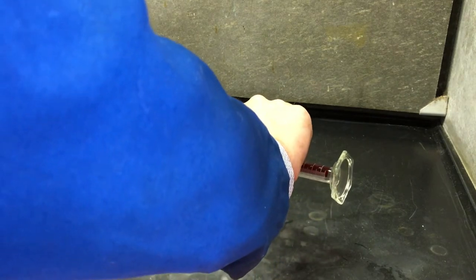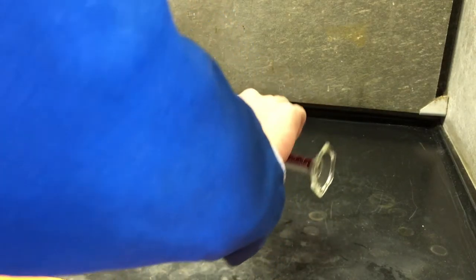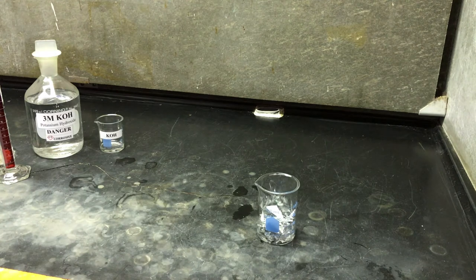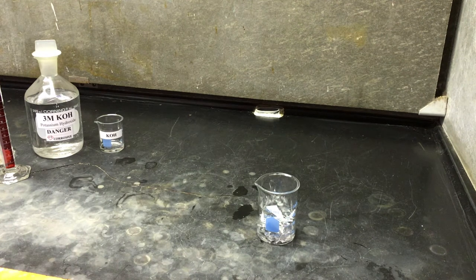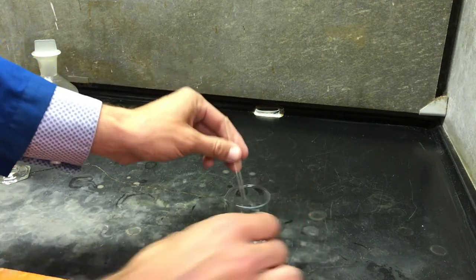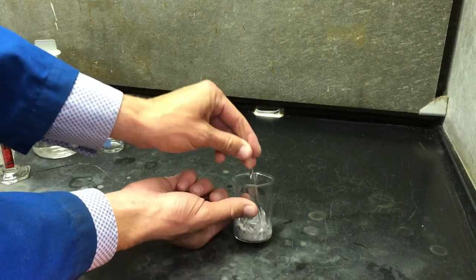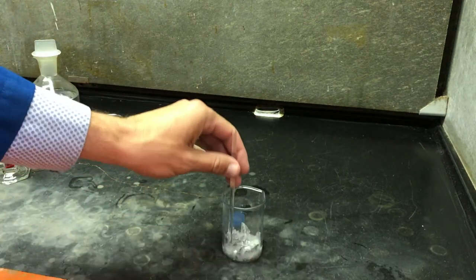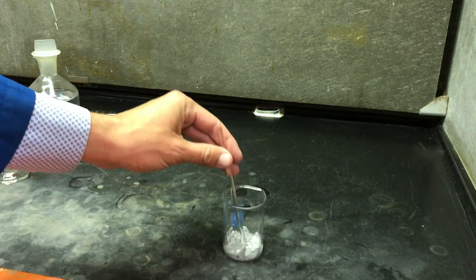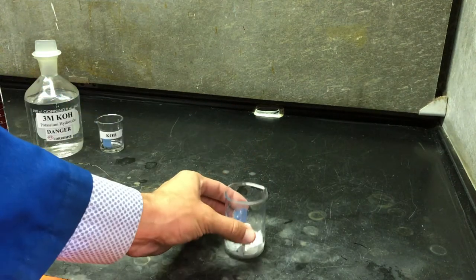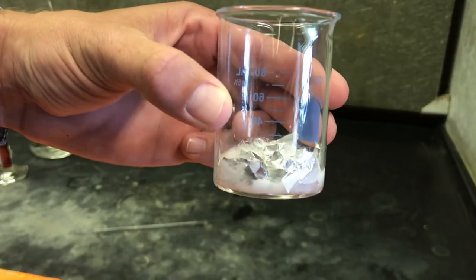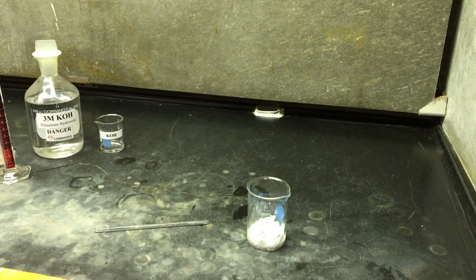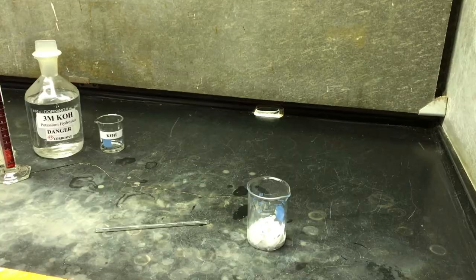This reaction step involves H2 gas, so we will perform it in the hood. We'll stir with a glass stir rod, ensuring all of the metal has dissolved in our solution.